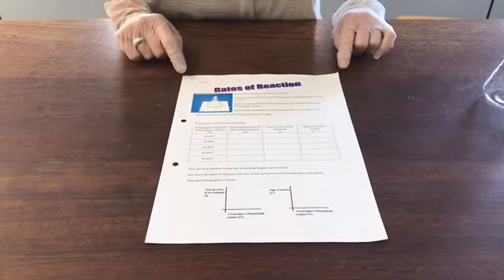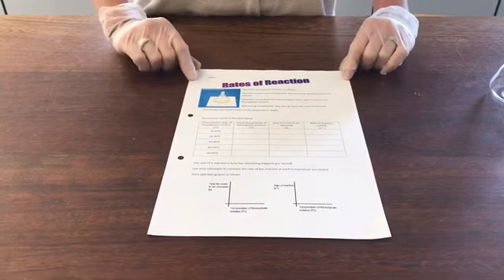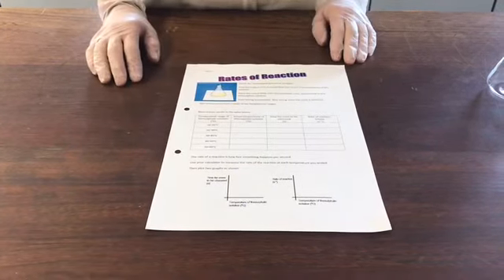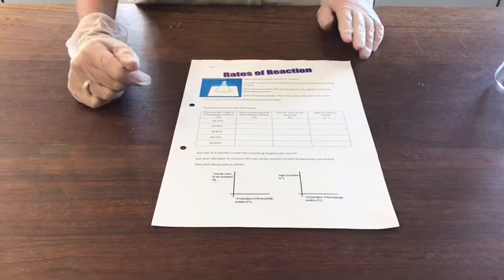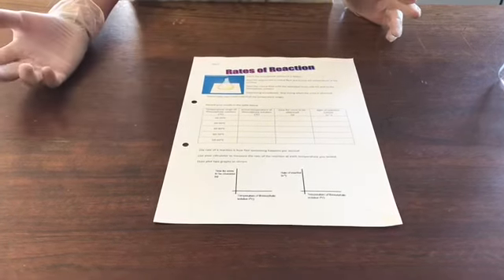This is the experiment worksheet that you're going to use for today's lesson. So we're looking at how temperature affects the rate of reaction. So this should be the one that you've got in your class notebook. Now I'm going to do the experiment several times over, and I hope to get something in each of these different temperature ranges so I can see the effect of the different temperatures, and I should get enough data to be able to plot on a graph.